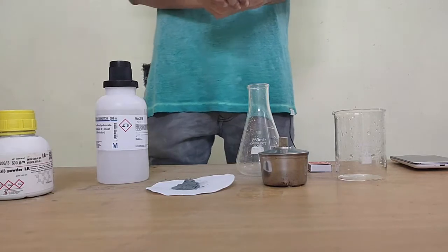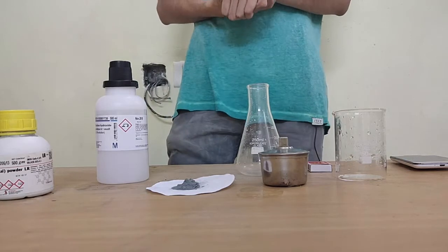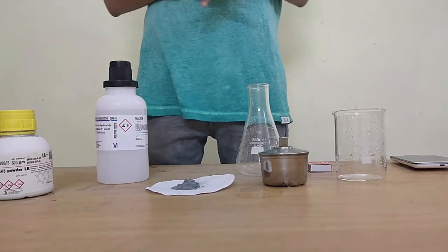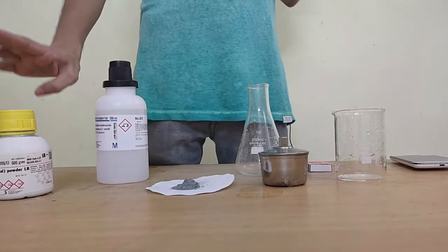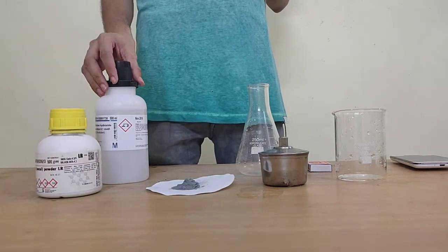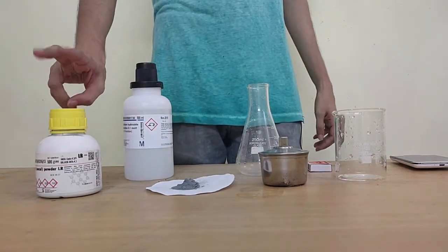Now if I have to come to the equipment or the apparatus, first mainly my reactants - what I'm going to start with. As usual I will start with my metal and my base, the main two reactants.